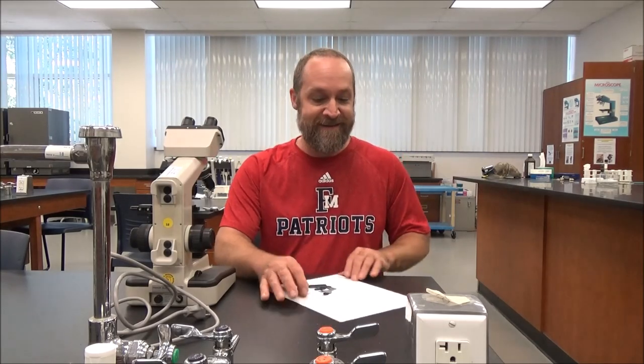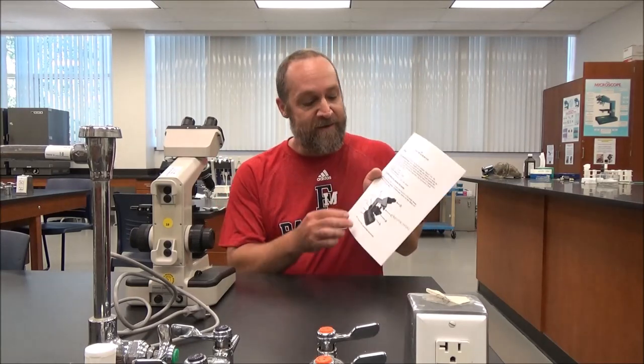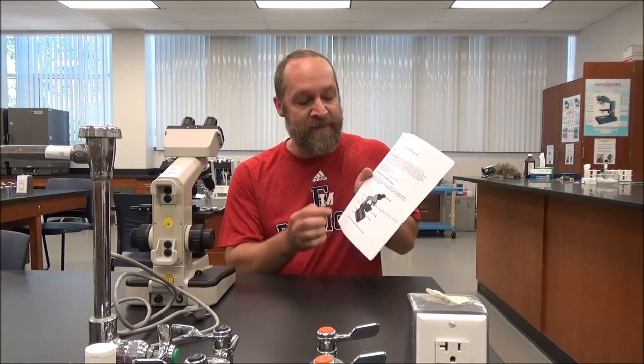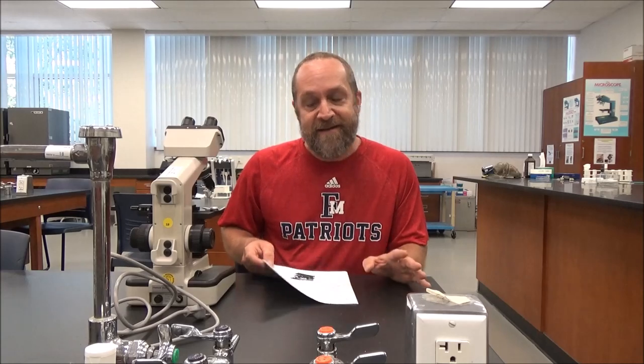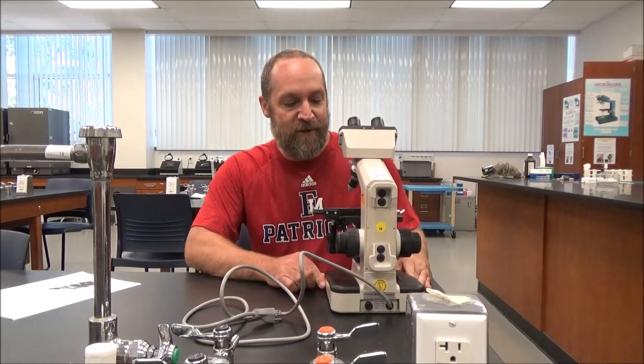Hi, I'm Dr. Greg Pryor, and this is Lab 1: Use of the Microscope. Read the PDF, know all of the vocabulary, know the parts of the microscope, and know all of the instructions provided in the PDFs. But I'm going to show you hands-on what it's like to use the microscope and to look at bacteria through the microscope.